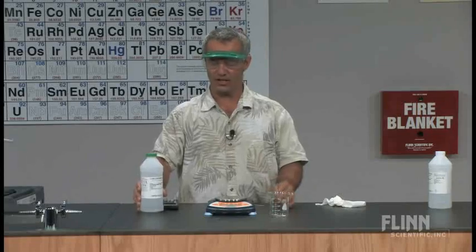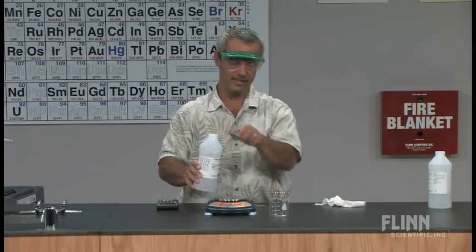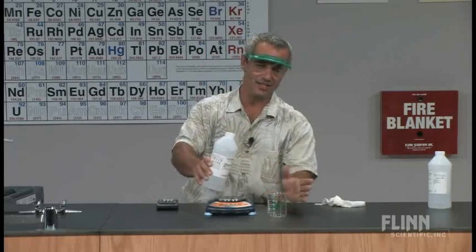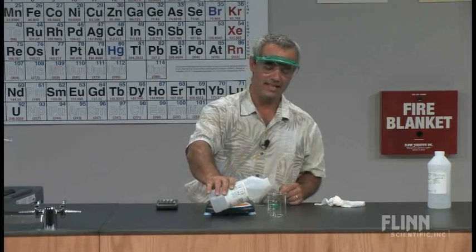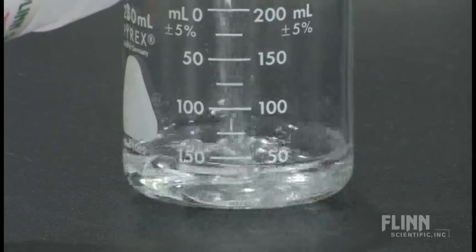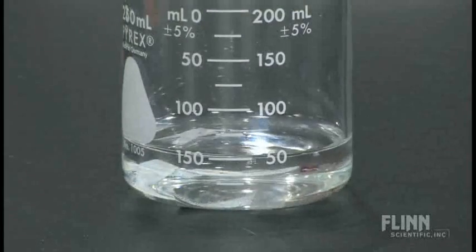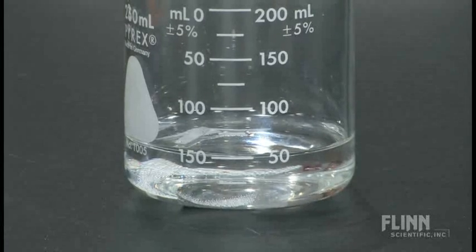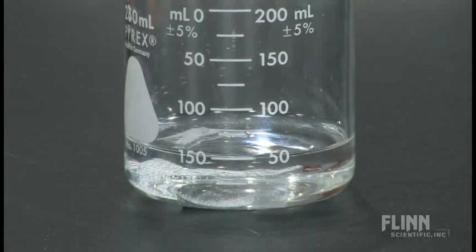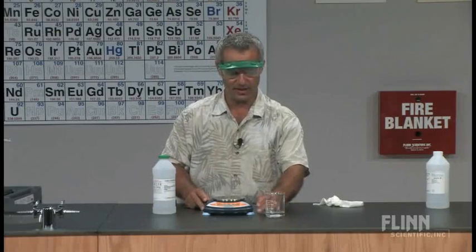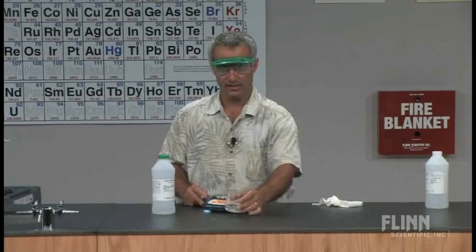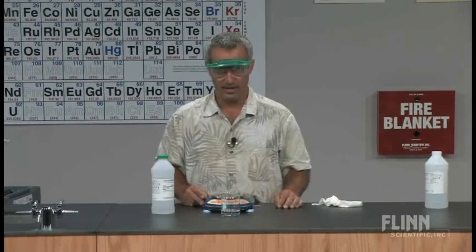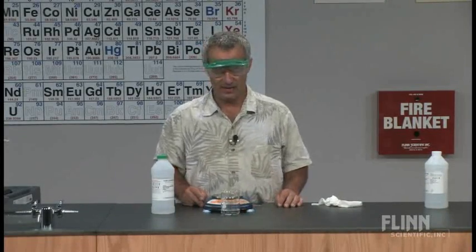Some three molar HCl. They add, it doesn't really matter as long as they don't use too little, they add about maybe 50 milliliters of that. Right away they can observe a reaction. I'm going to put this here so you can see that reaction better. Little bubbles of hydrogen gas forming.